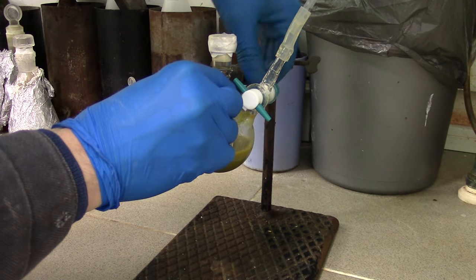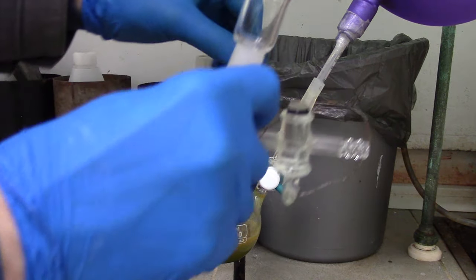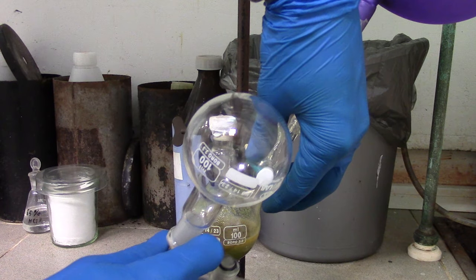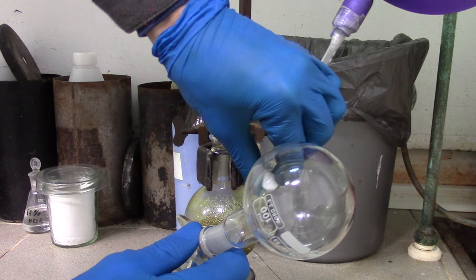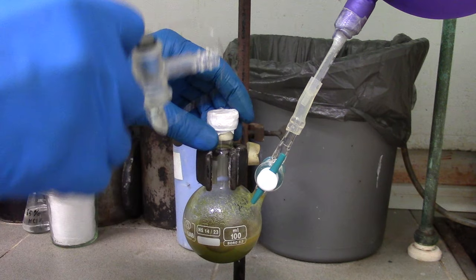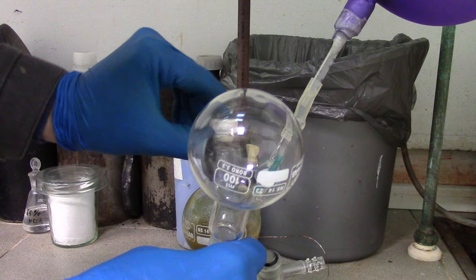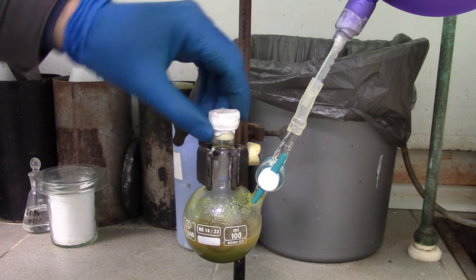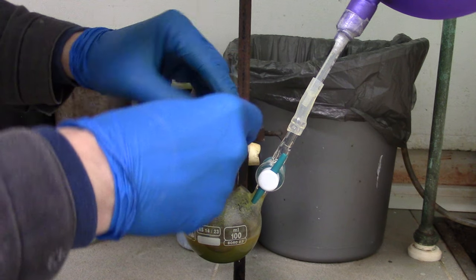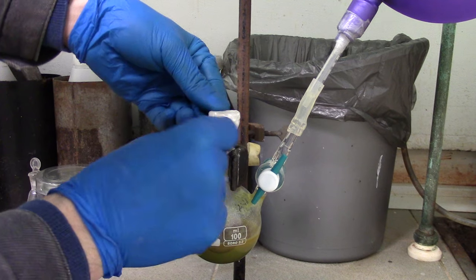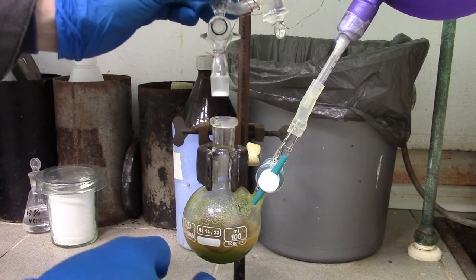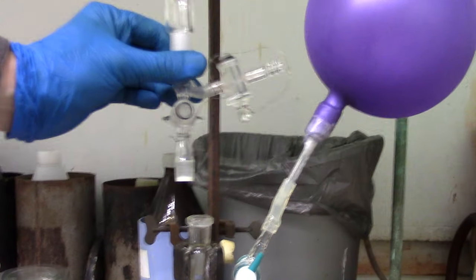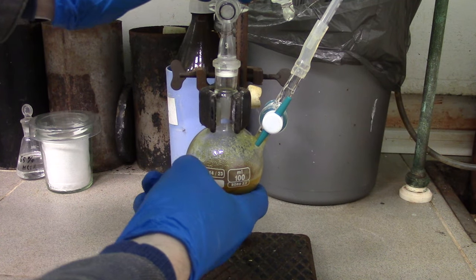Further, Schlenk vessel with the reaction mixture is placed into clamp. Now watch carefully. Outlet taps are closed. And now you need to switch on an argon flow, in my case by opening a plug connected to balloon. Next, remove the septum, purge argon a little bit, then seal the construction at all.